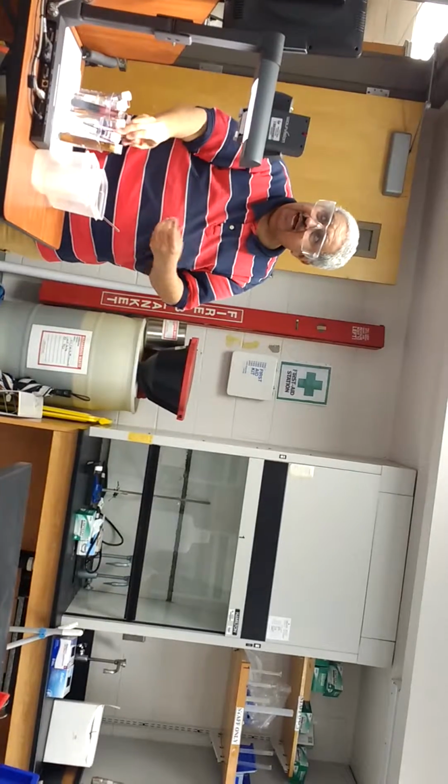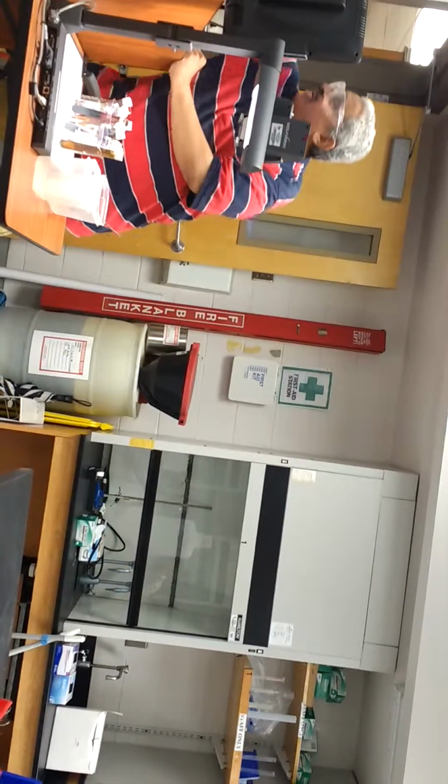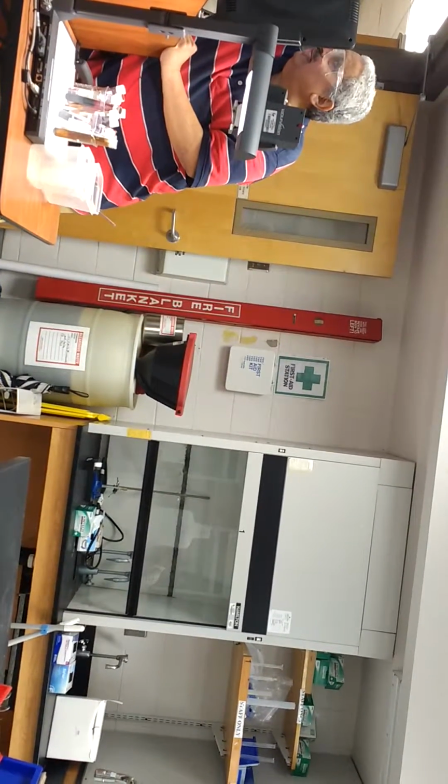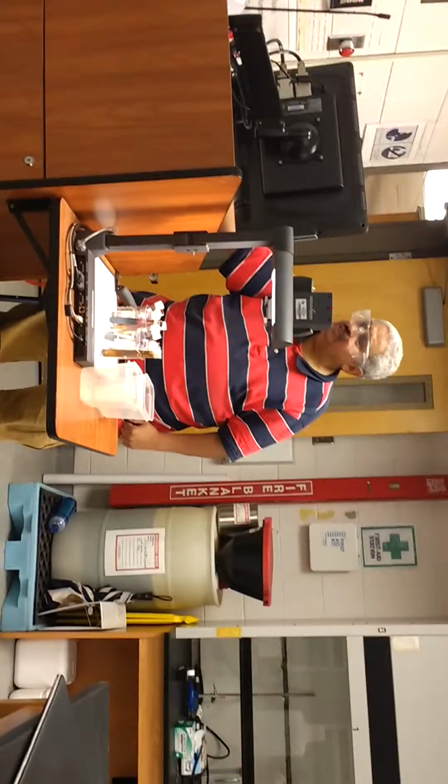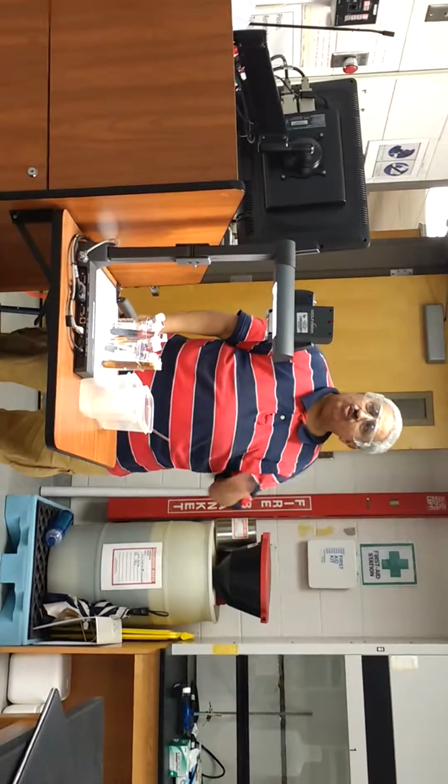So, as you see now, I'll switch here. You can see these results inside. If you look at this, the information here is given to you, and I can just show you here, all this information given to you. Here it is, can you see it? So all the information here you can see: like dissolves like.